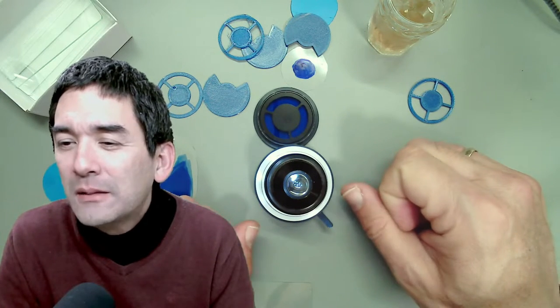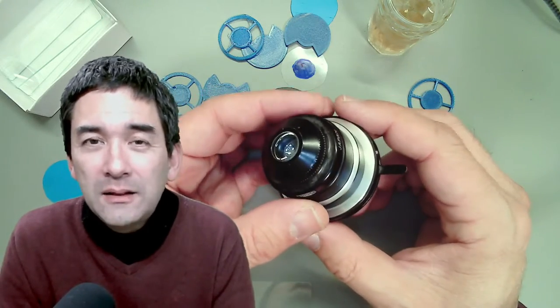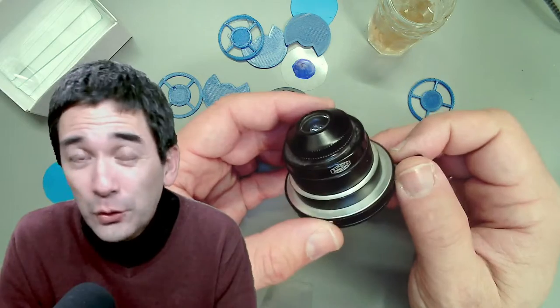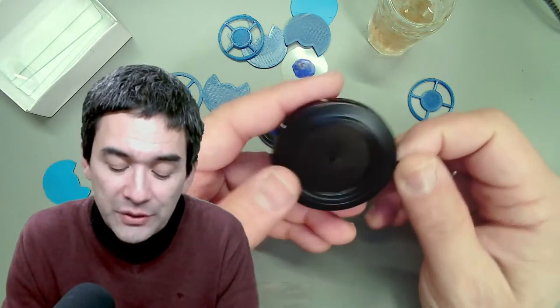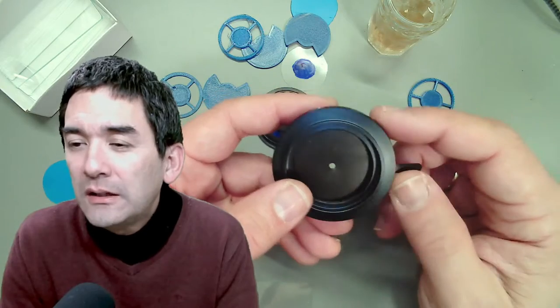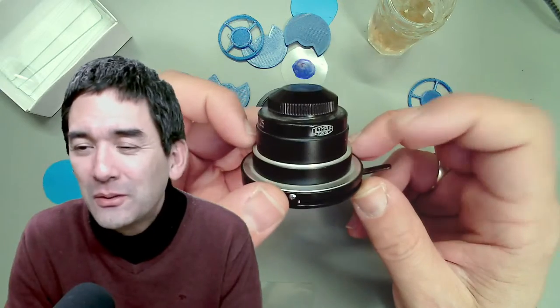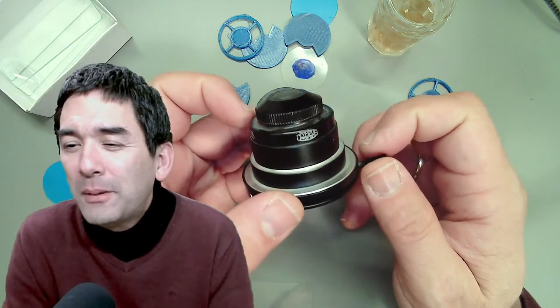Can this be done with a cheap scope with a small plastic condenser? Your microscope must have a condenser — that's really important. Some introductory microscopes don't have a proper condenser, and then unfortunately it's not possible. The reason is that the angle at which light strikes the specimen is very important, and the condenser is responsible for adjusting this. Some cheaper microscopes only have a wheel with different openings, which is not a full condenser — unfortunately that's not going to work.